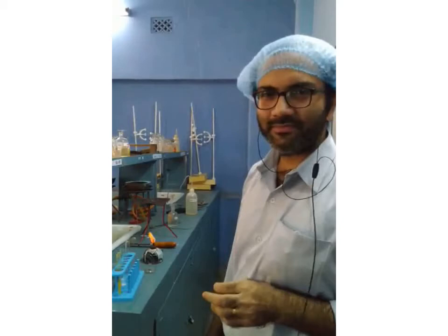So there you've seen the experiments being carried out, and I hope you have enjoyed these reactions, the precipitate formation, the color changes which have taken place, and definitely along with that, you have recorded and noticed the different observations. Although it's already mentioned over there regarding the reactions, while writing there was a small error regarding the balancing of the first reaction. So, I'll move on to the final conclusions from this particular experiment.